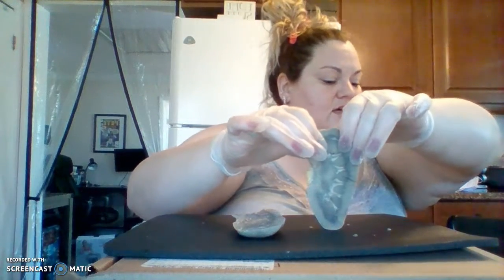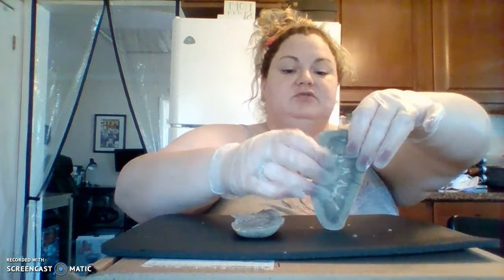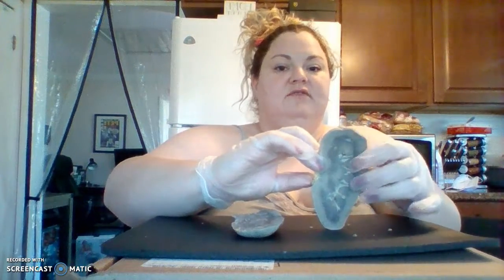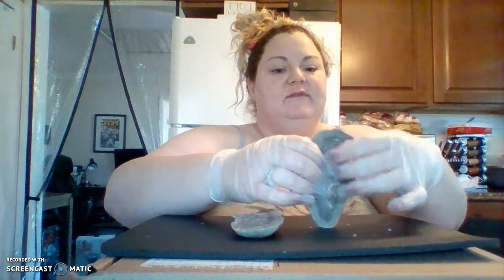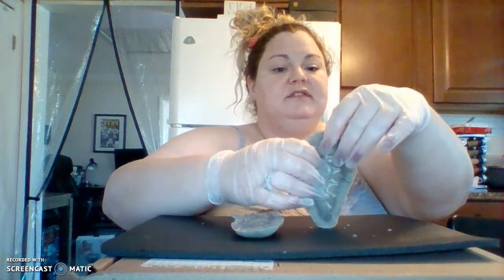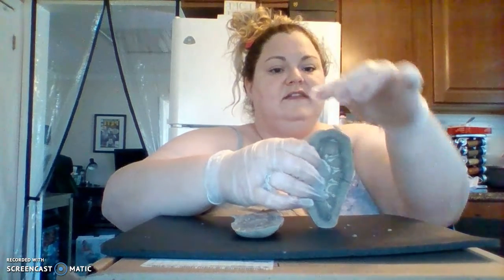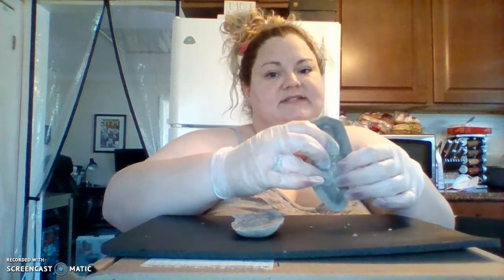And then let's see, I believe that is the hilum, which would be this whole little area over here. And again, I believe I mentioned the renal sinus before. Then we have the renal columns again over here, the medulla, the pyramids up here, and then the cortex. And then the base of the pyramids would be somewhere down over here.